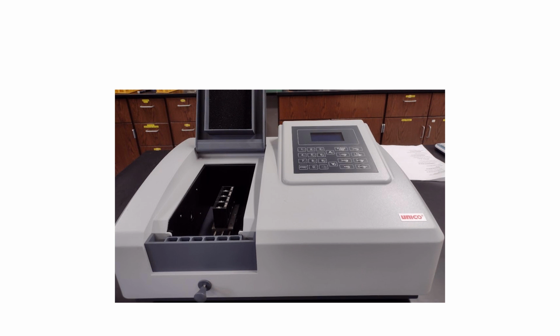We have just started in the fall of 2024 because we just bought the spectrophotometer, which is what this equipment is. And we're starting to incorporate it into the lab portion. For the online portion, we have you do the worksheet. So this will explain how we got the numbers on the worksheet, hopefully.